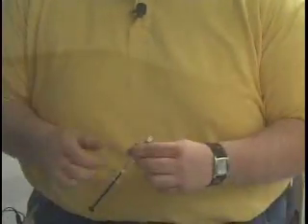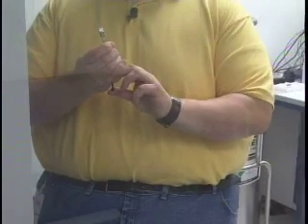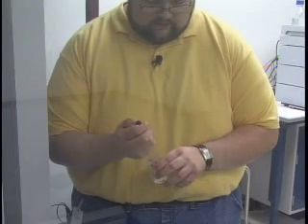It's only just squirting through here. Mix it. Now it'll work. I don't know. We'll make sure we mix it before we even shake it.